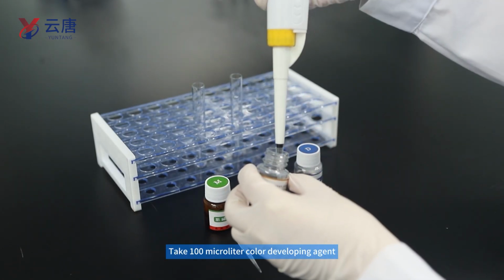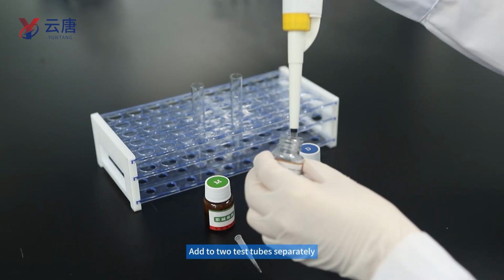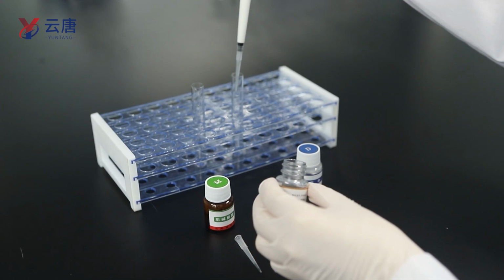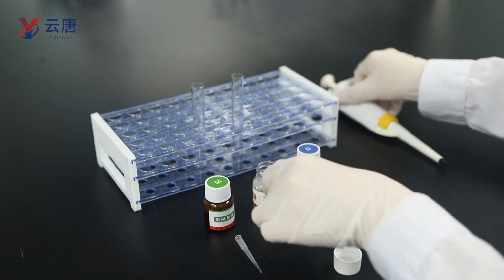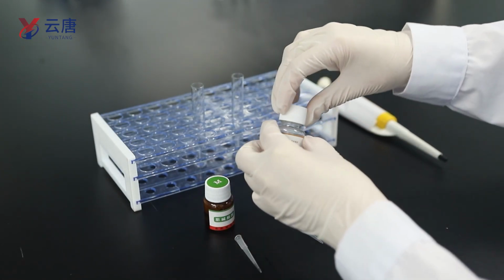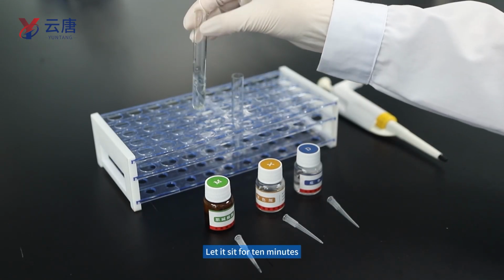Take 100 microliters color developing agent. Add to 2 test tubes separately. Shake mix. Let it sit for 10 minutes.